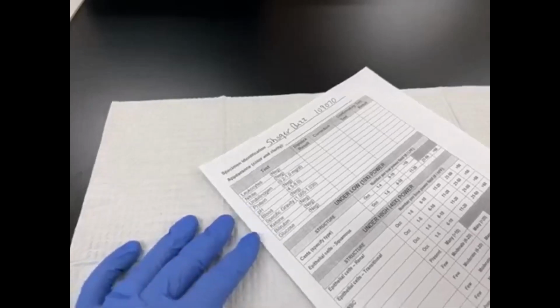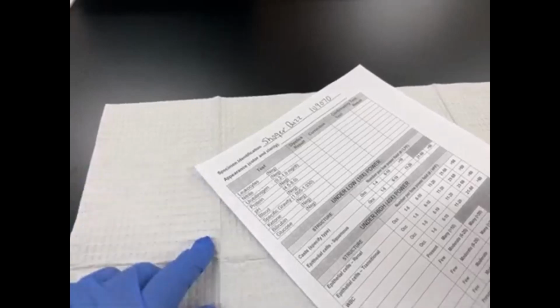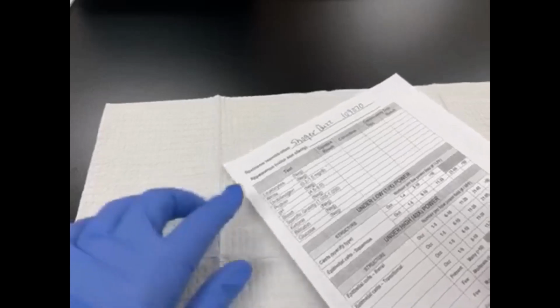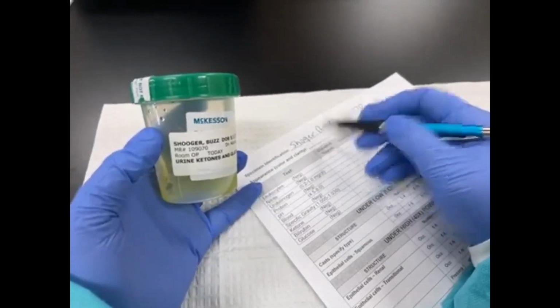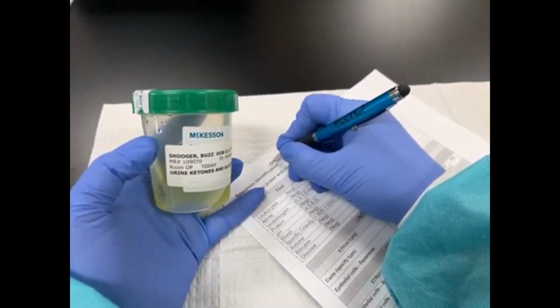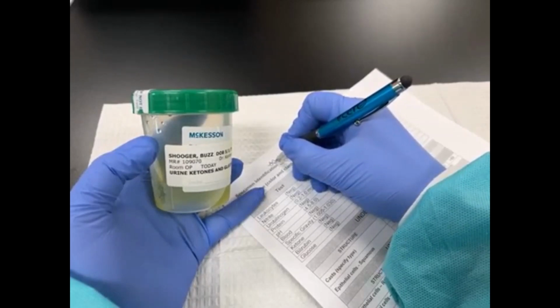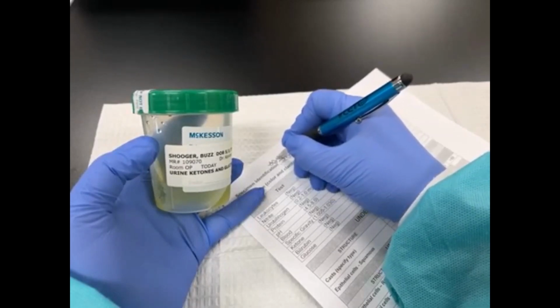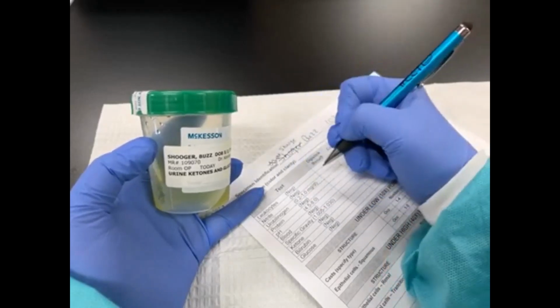Whenever we're looking at error correction, there's only one acceptable way to do it. You cannot just scribble a word out. You cannot do a write over. For example, I wrote here, you can see his last name. I spelled it S-H-O-O-G-E-R, and I spelled it S-H-O-G-E-R. The only acceptable correction: draw a line through it, put your initials and the date next to it, and then write the correct spelling of the name on the top.